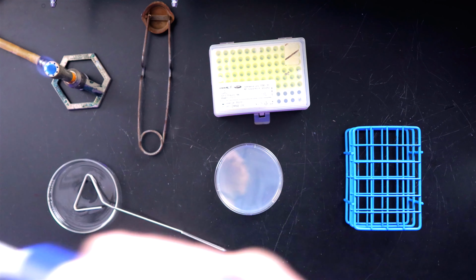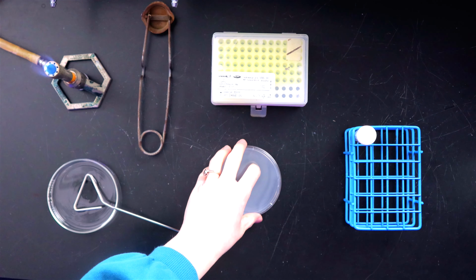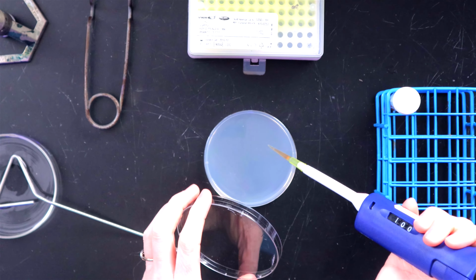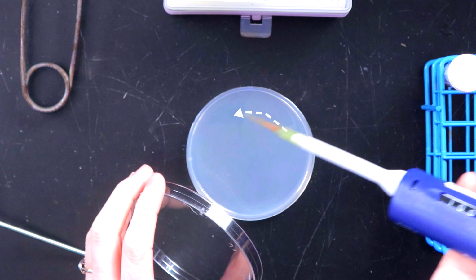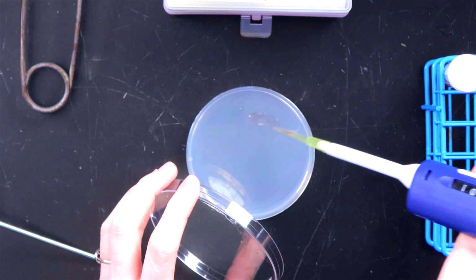And then we're going to aspirate 100 microliters of our sample into the micropipetter. Okay, very good. There's a little one-handed trick that comes in pretty clutch doing this. So we're going to put the sample on the plate in a crescent shape.